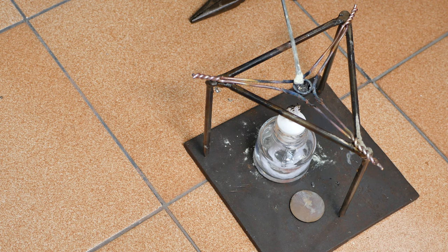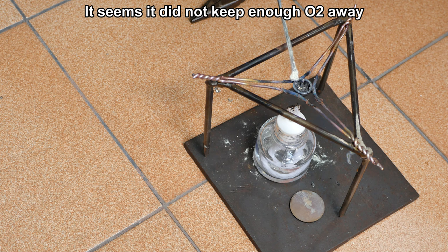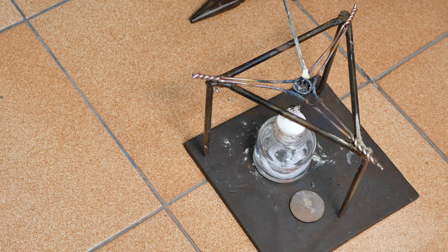Let it cook until the sulfur had burned off. You can see the blue flame that comes out from underneath it, or barely see it, I should say. And I didn't know what was going to happen, to be honest. I'm not a chemist. Sulfur can start popping, especially if it's damp, and start throwing stuff out of there. The lid was to keep as much oxygen away as possible so that the sulfur would react with the lead first. And then I was occasionally touching the lid with a solder to make sure that it was at the temperature to melt the lead.